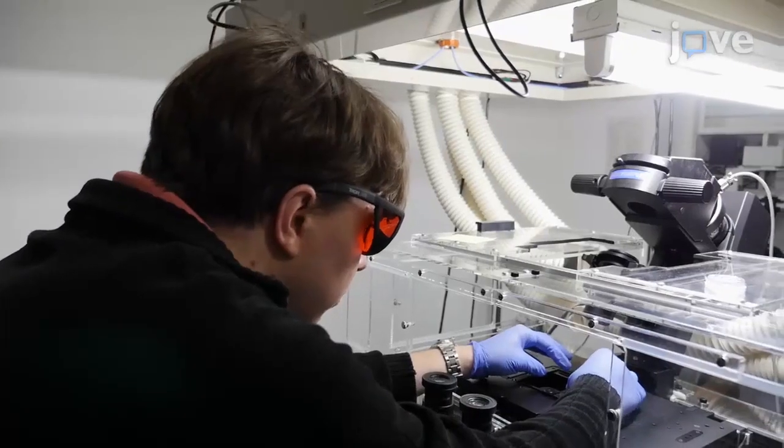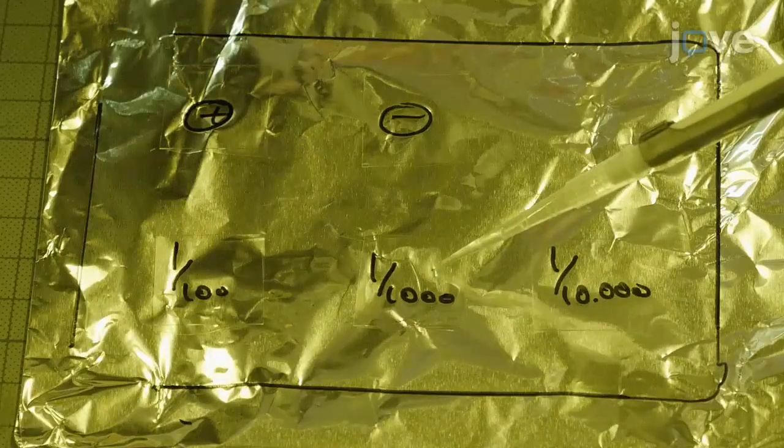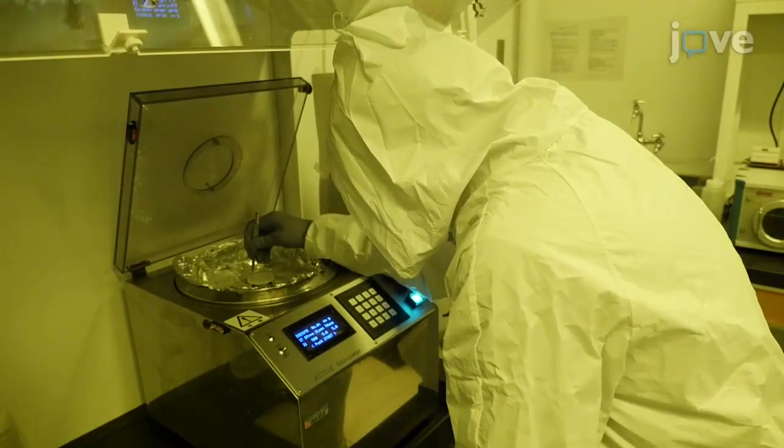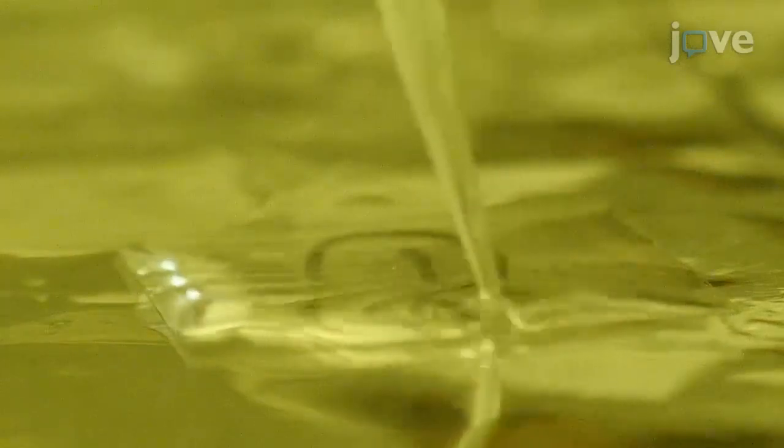The most critical point of the technique is obtaining data reproducibility. I recommend keeping the same experimental condition as much as possible when measuring multiple samples. Visual demonstration of this technique will provide how to make each experimental step stable and reproducible. It will also show some uncommon steps in biochemistry protocols, such as the spin coating and washing of microscope cover slips.